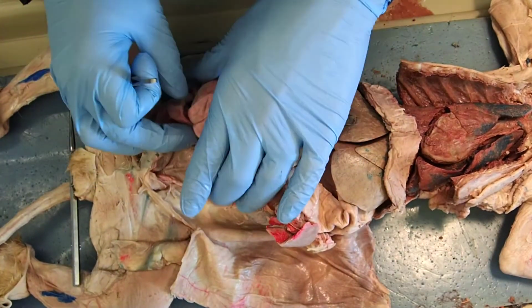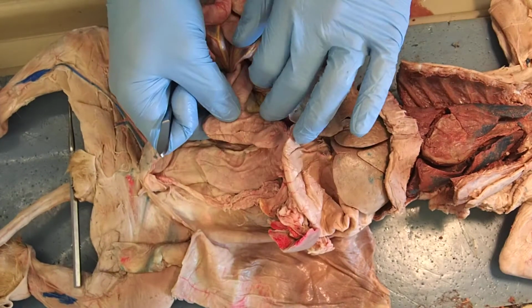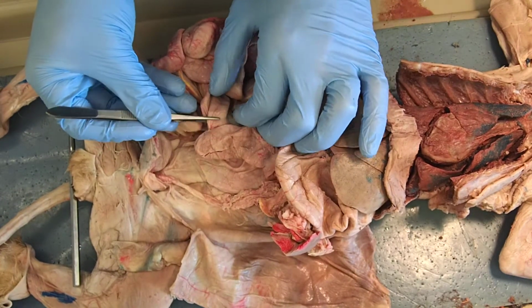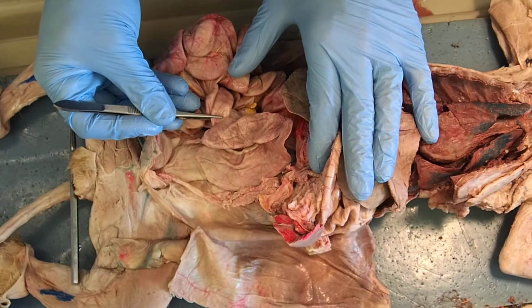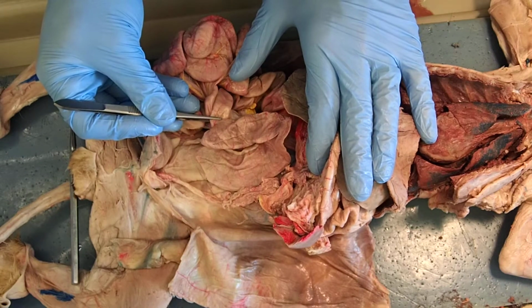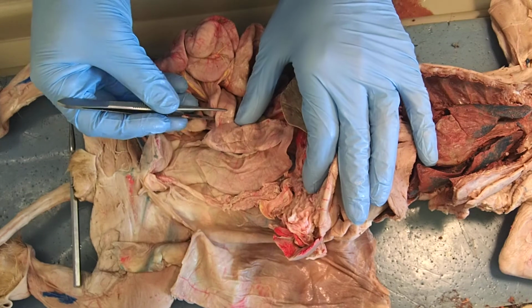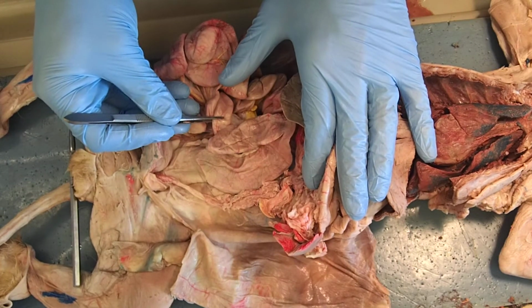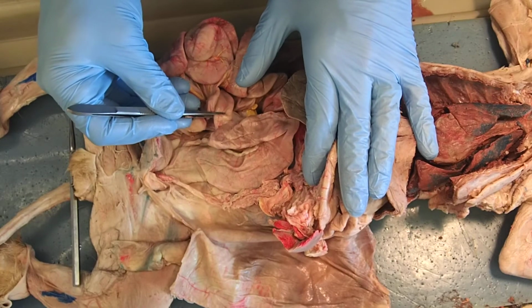So on an exam, I might show you this structure here. And you can clearly see that this would be the ileum. And I might ask you, through which specific structure did foodstuff pass prior to entering into this portion of the small intestines? And that would then be the jejunum, because you know this is the ileum.